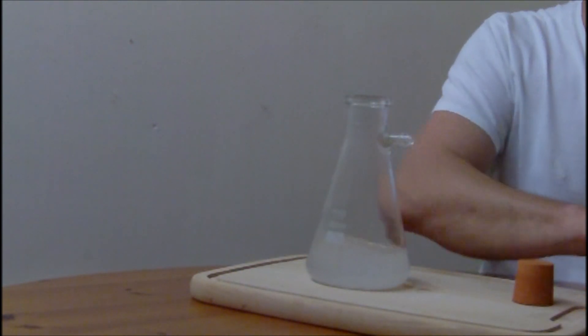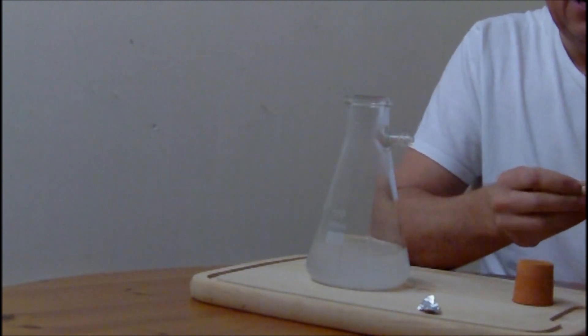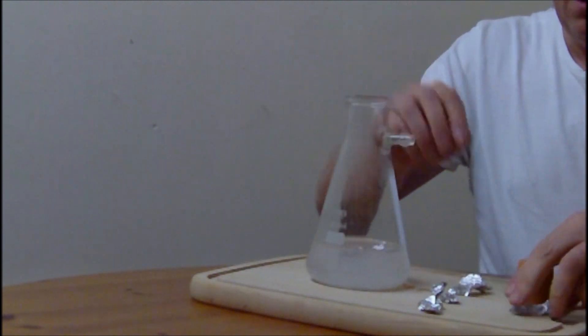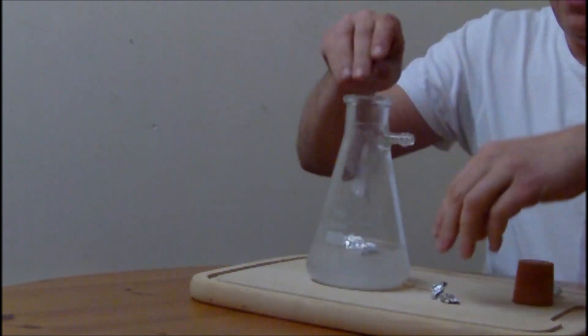What we need to do now is get some tin foil. The tin foil is going to act as my catalyst. Let's put tin foil in. Away we go.